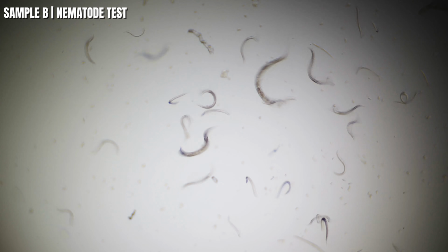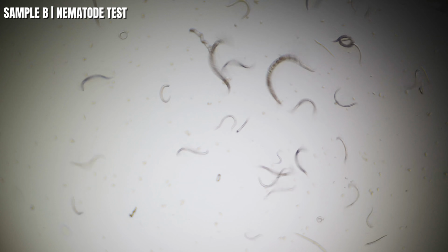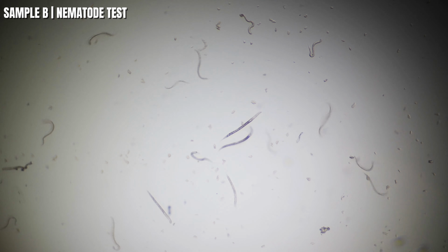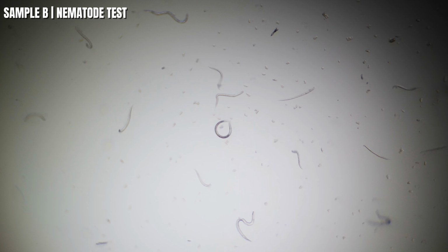So watch the left part of your screen and watch the reaction and compare them to sample A and see if you guys notice any difference. Good, there it is. So just watch them and let's have a look. And right away, guys, I can tell they're slowing up big time, faster than sample A's. So let me go ahead and speed it up and see where these are.